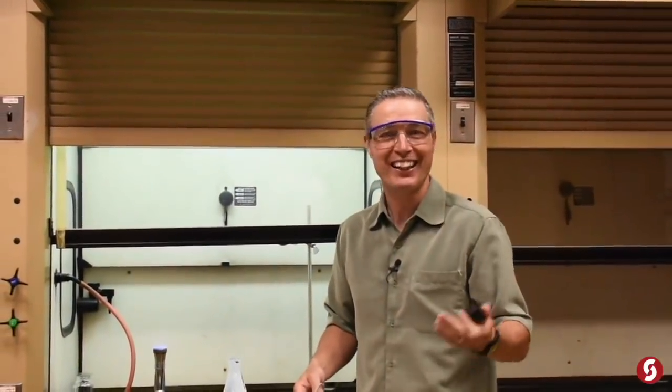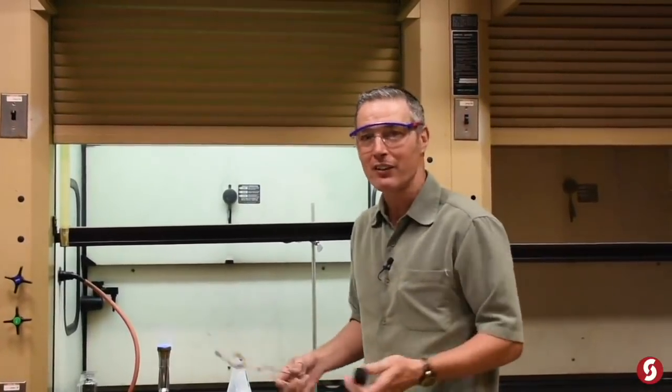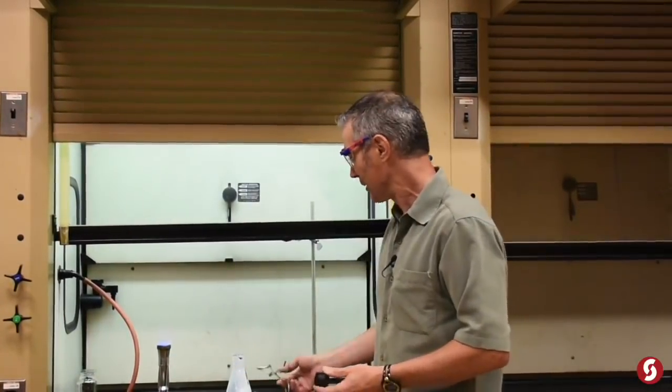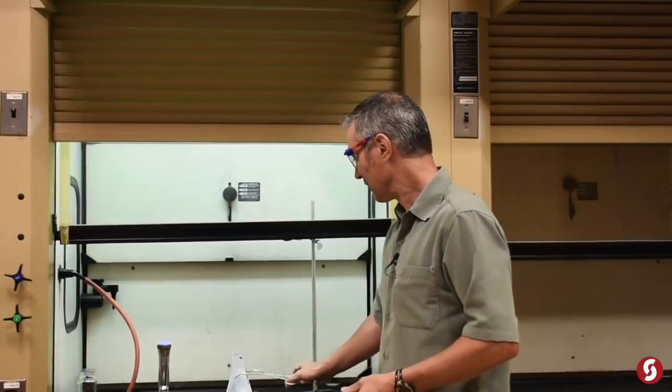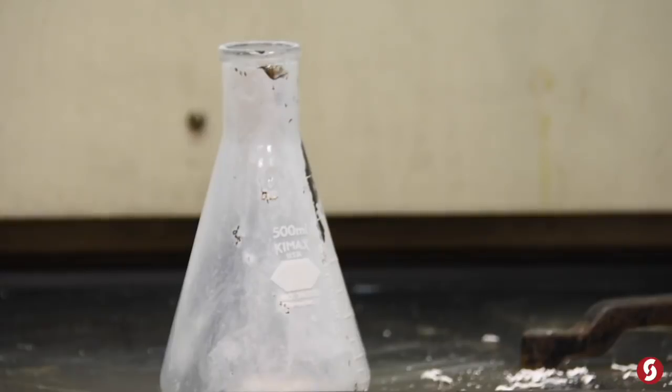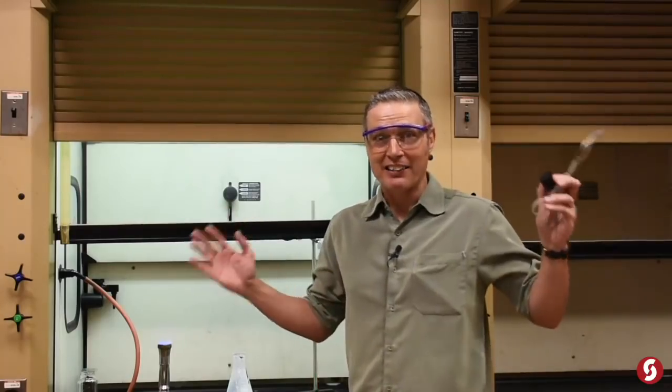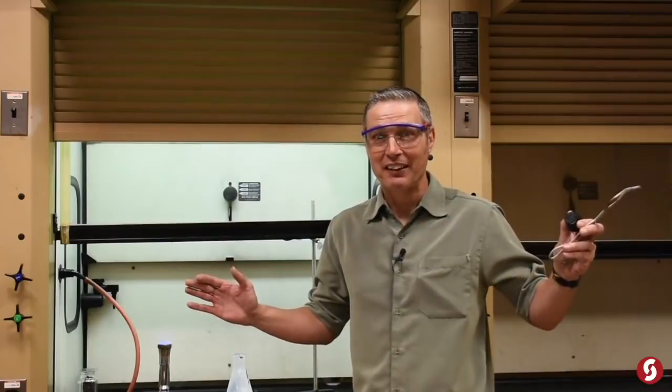I'm seeing spots. I can't even see the camera. What took seconds before, what, twenty seconds? I don't know, to burn that big strip. We just took care of in like a fraction of a second. That thing is coated with magnesium oxide. I am out of here, guys. I lived. Until next week.